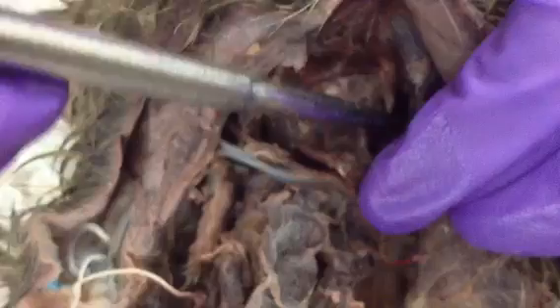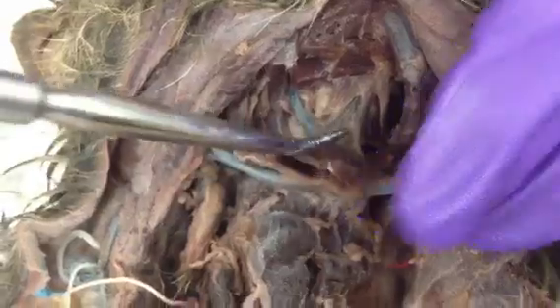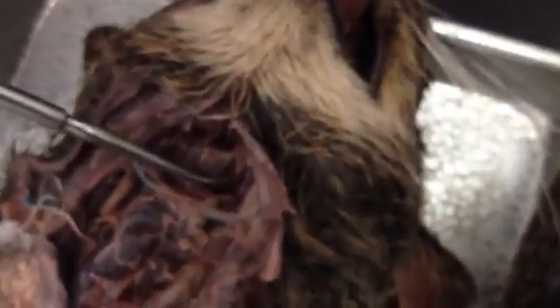So all of those ones that end in glossus, the genioglossus, the hyoglossus, and the styloglossus, all are a part of the lingualis proprius muscles, and that's a complex, and they're called that because they all go to the tongue. And so like when you wiggle the tongue or move it or pull on it, you'll see that all of those move because they all go to the tongue. And I'll show you a better image of them on Amelia's cat.